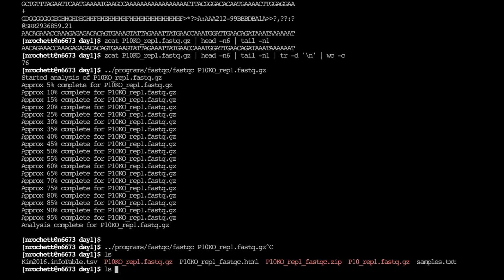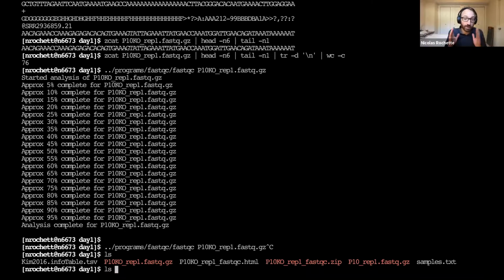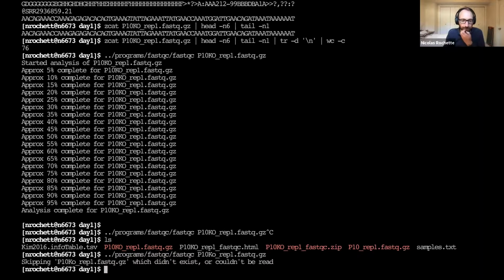Yeah. So for paths, one program that I really recommend you use, let's say I was running fastqc, and then okay. And so I've tried running this command here, and it failed. It told me like P10Ko_rep1 fastq.gz does not exist, which is true, because the actual reason here is this is not a capital O, this is a lowercase o.